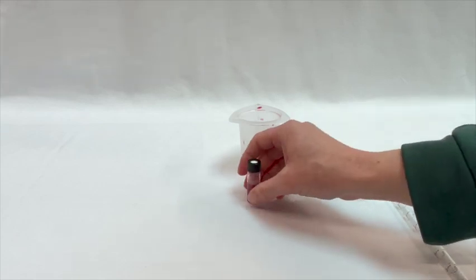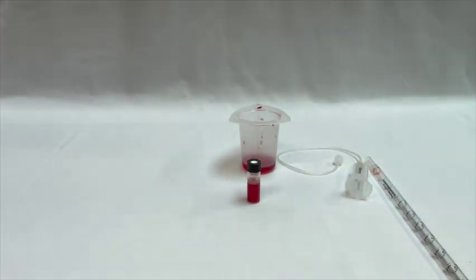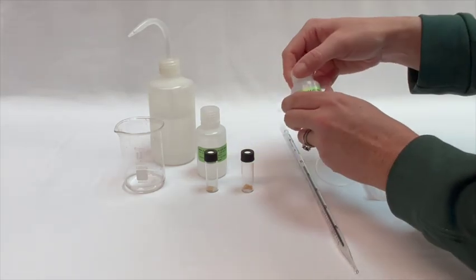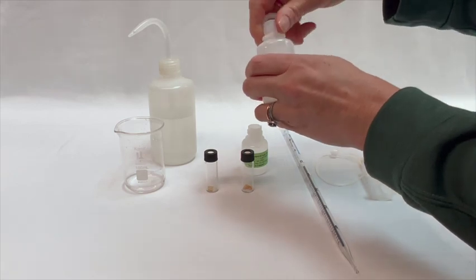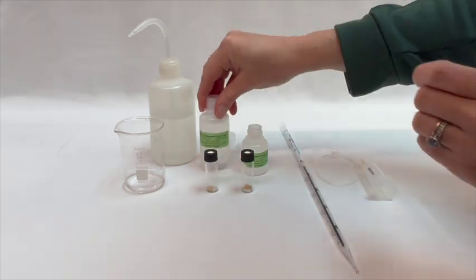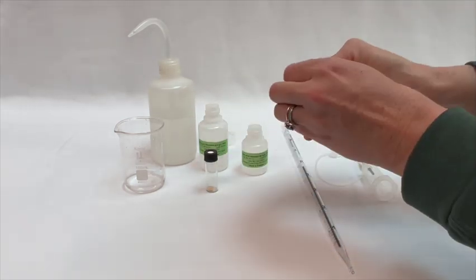If you are performing the quantitative mode, you will follow a similar procedure as you just did with your wine sample. You will simply add 3 ml of each standard to 2 different vials. Here, we are using the provided 0.0 g per liter and the 0.4 g per liter standards.